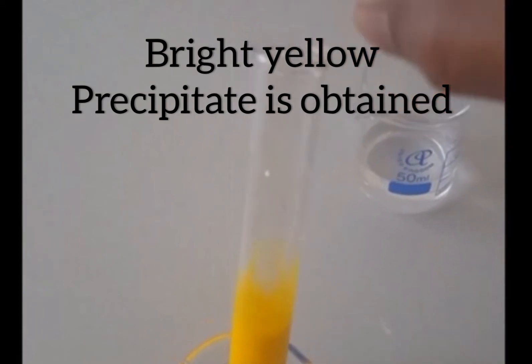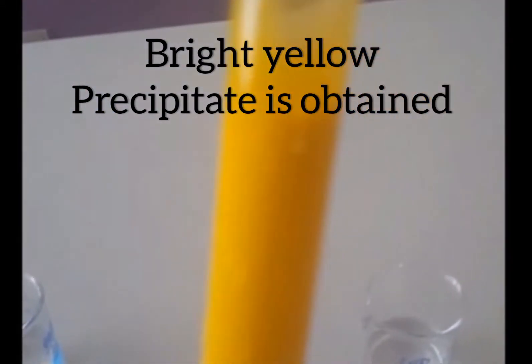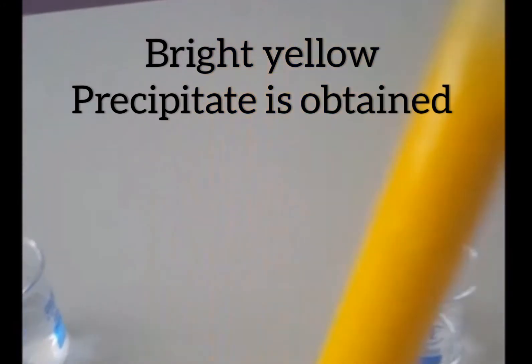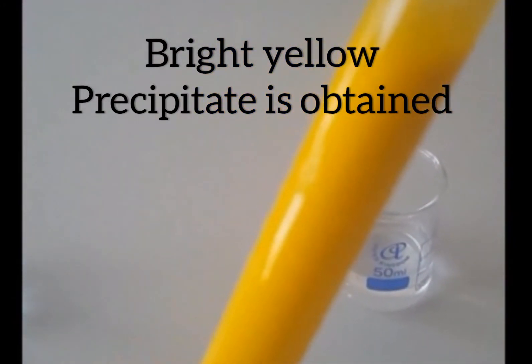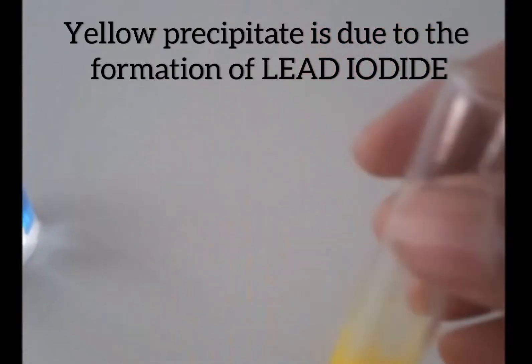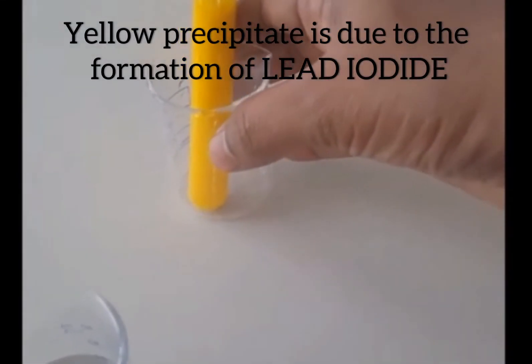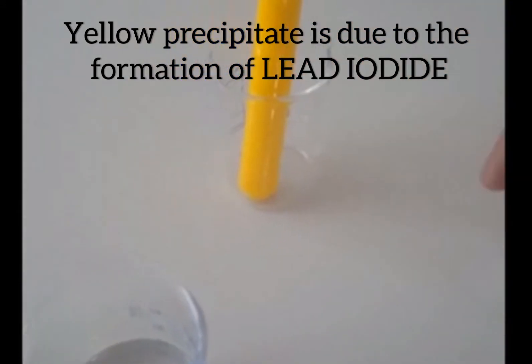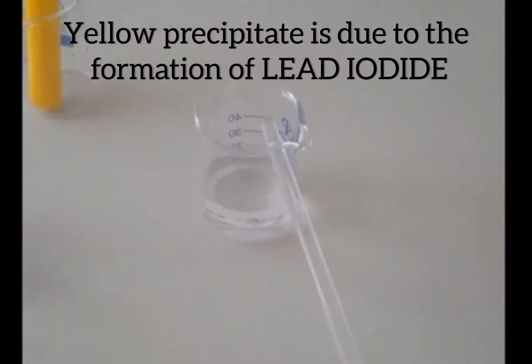You can see a bright yellow precipitate is formed when you mix lead nitrate with potassium iodide. This yellow precipitate is lead iodide. When lead nitrate is mixed with potassium iodide, lead combines with iodine from potassium iodide and lead iodide is formed. That is the yellow precipitate formed in this reaction.